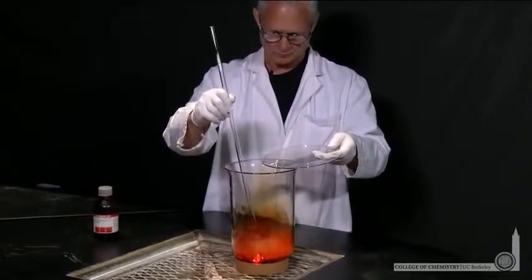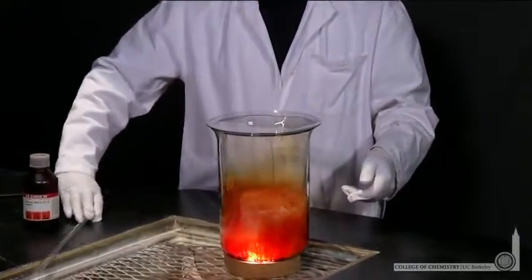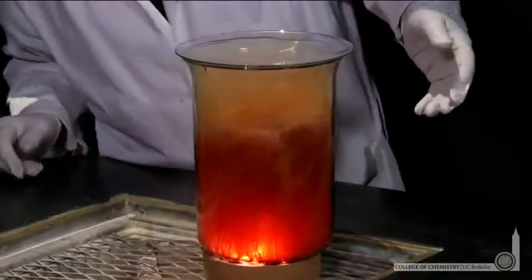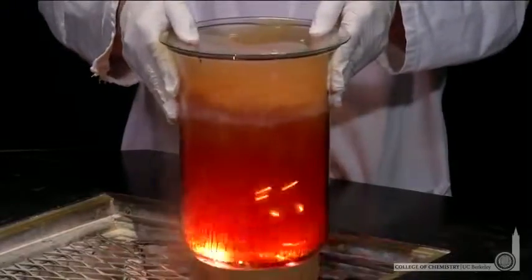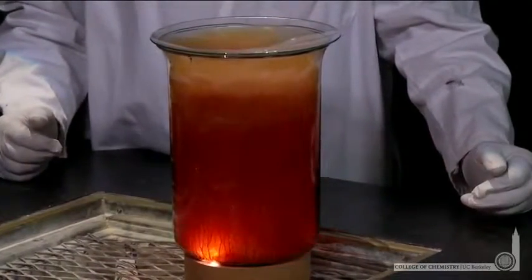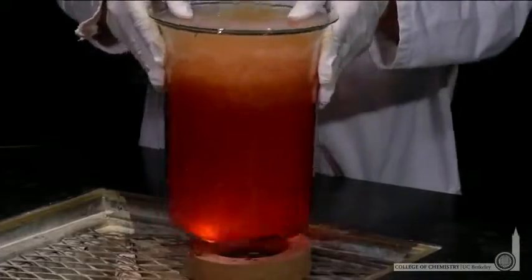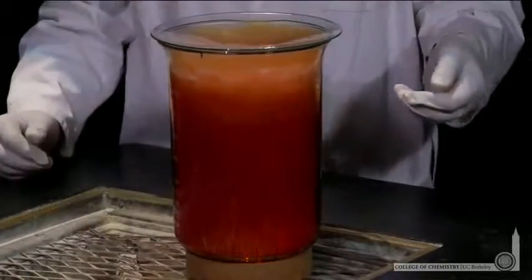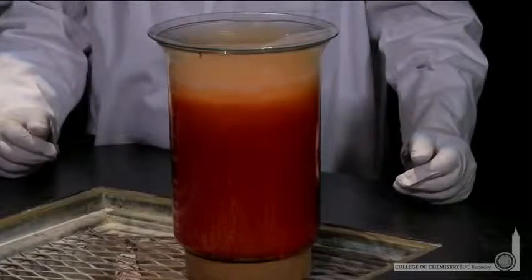It's easier to do this reaction where we form the aluminum bromide. That reaction is exothermic, as you can see, but it proceeds with a decrease in entropy — the liquid bromine is used up. But because this reaction releases enough energy, it's enthalpically driven and proceeds at low temperature. Although entropy decreases, the enthalpic portion is great enough to drive this reaction spontaneously at low temperature.